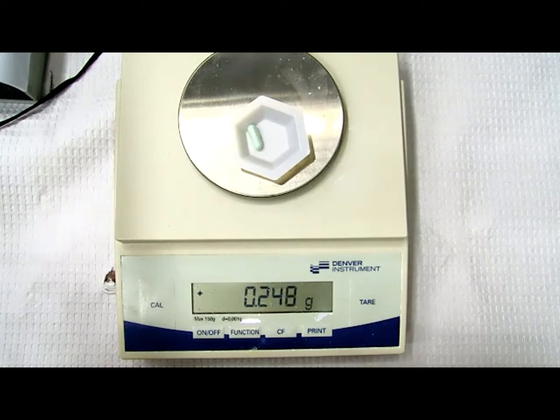And what Judy was trying to say is that the first couple of capsules are easier to punch. The last couple of capsules, because there's not as much powder left, it gets much more difficult. So your capsules tend to be lighter. You have a hard time getting them heavy enough to the target weight. That's where the sliding method and the kind of cheating method of putting some powder in the capsule cap actually will help you get to the right weight. So those are things you can do.